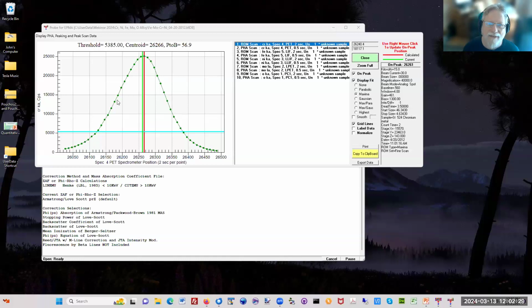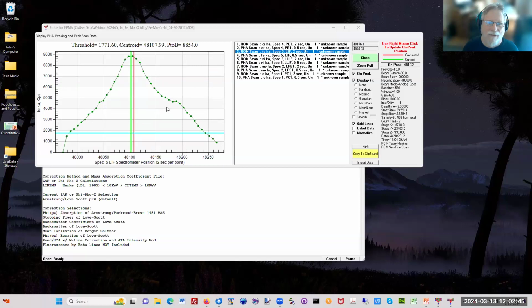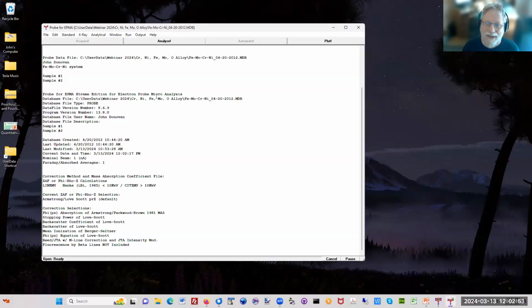So here's a peaking scan I did, and I tuned up the chromium, so I got that record, and I can see that I adjusted it from the maxima fit manually, and then here's the PHA scan on the chromium, and here's the iron. You can see the K-alpha 1, K-alpha 2. So having a record of everything you did that's saved automatically is great. The only thing that's not saved automatically, of course, are the images, the backscatter and secondary images, because those can need adjustment and stuff like that. But it will remind you if you did forget to save it. So that's good.